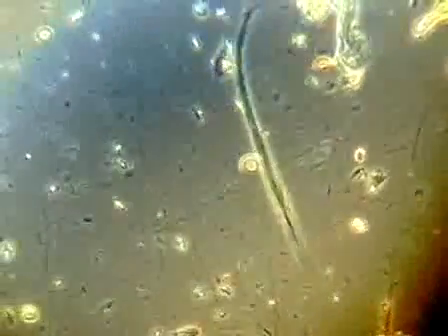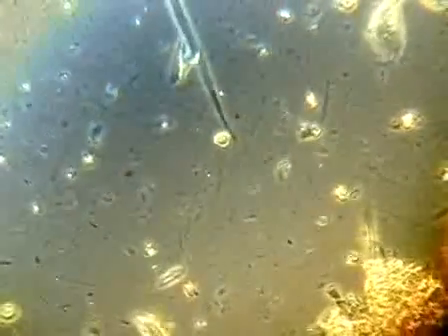And here you can just see a swarm of protozoa organisms, probably right next to a very large species of Trichonympha there. It's one of the largest organisms in the termite gut. As you go down and you actually look at areas that don't contain these large protozoal cells, you'll see that the background, this sort of interstitial fluid, is also loaded with spirochetes and other bacterial cells. And so, the complexity doesn't get any less even in those spaces.